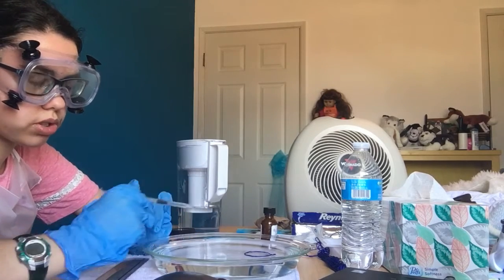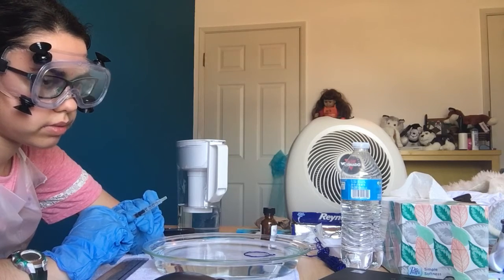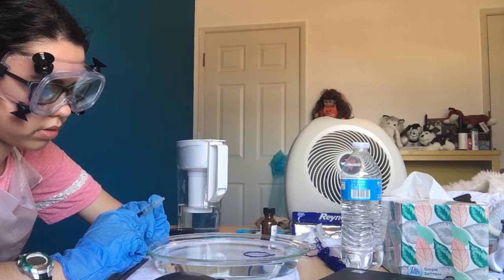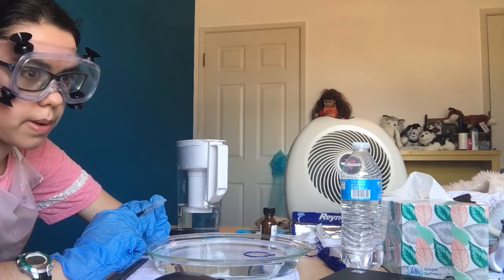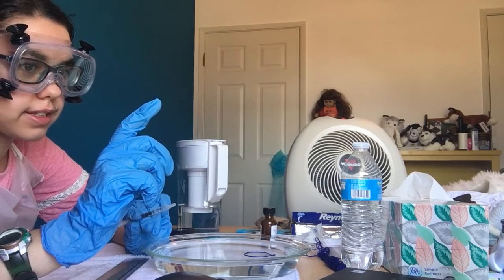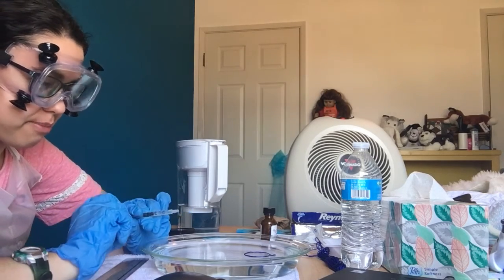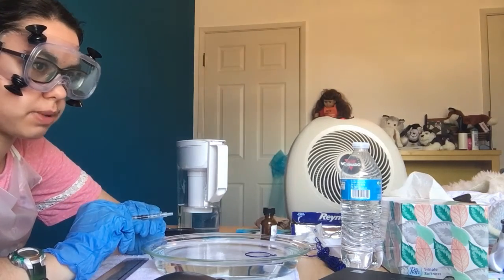Yeah, so then you'll wait a little bit for it to evaporate, and when it does contract, then you add another drop, and if the drop stays at the top and doesn't disappear quickly like previously, then it's done. The thing is, that's already happened. You already did that? Well, I put a drop in and it took like 15 seconds to disappear.